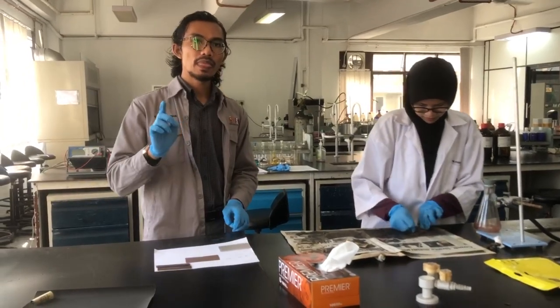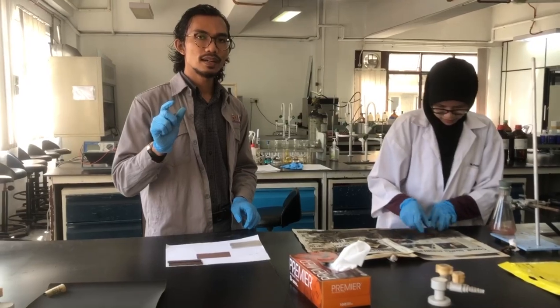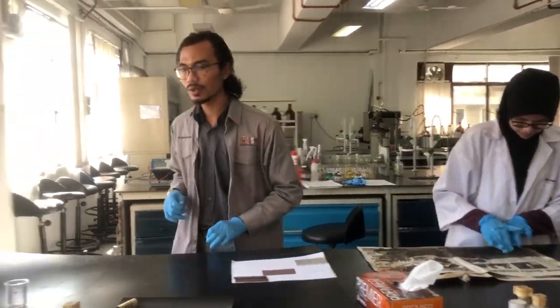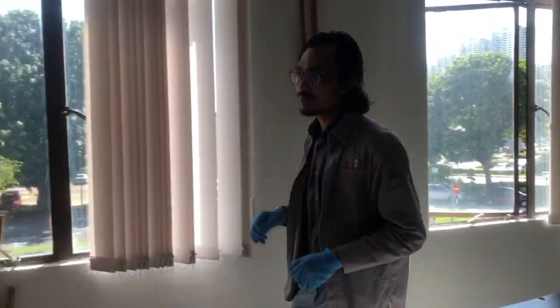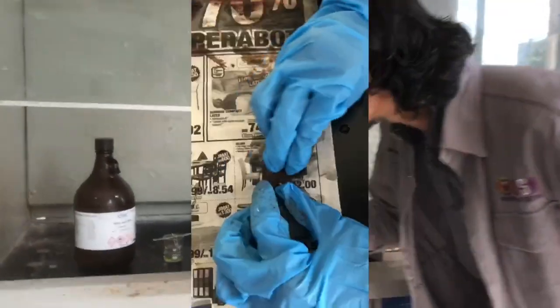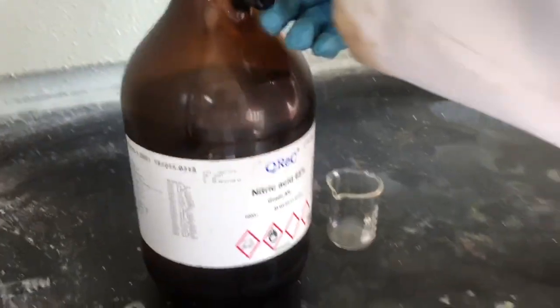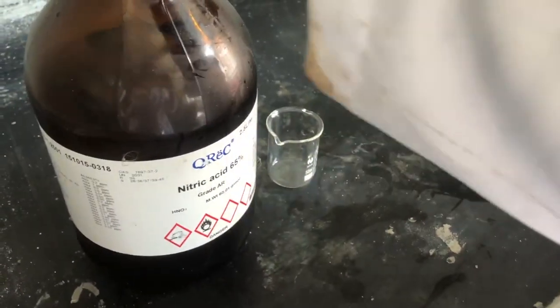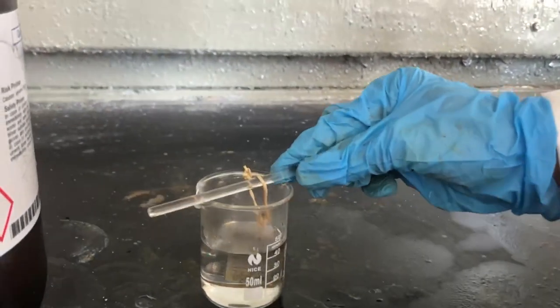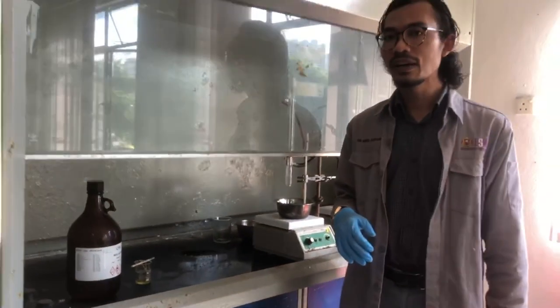Before we start Experiment A, we need to polish a small plate which we will use for Experiment D. We have already prepared and polished that plate. The polished plate will be dipped into nitric acid solution for a while, as part of the preliminary preparation for Experiment D — the effect of passivation.